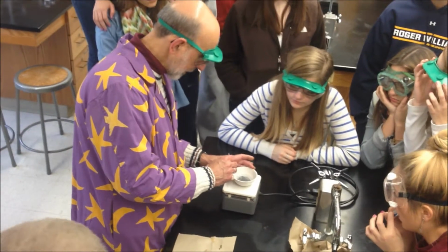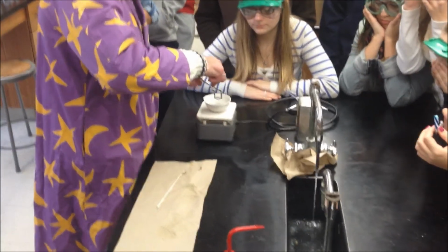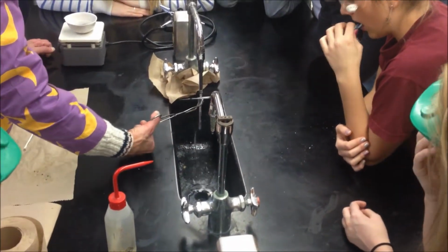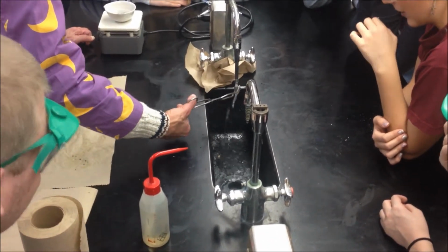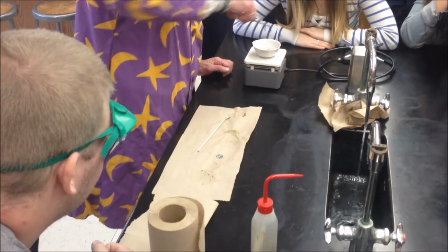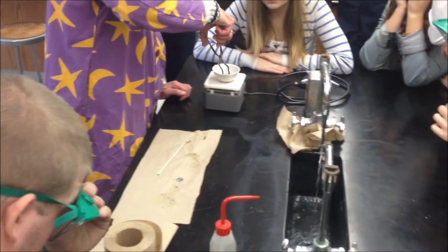Yeah, they think they're dimes. Have to get them coated. You can see because the original penny was very shiny. This is pretty shiny. Oh my God, that's definitely a dime. Yeah, Abraham Lincoln's on a dime. Well, actually we're going to do a little bit more. No way. Yeah, this is right. It looks like brass. How did you know that, Zach?